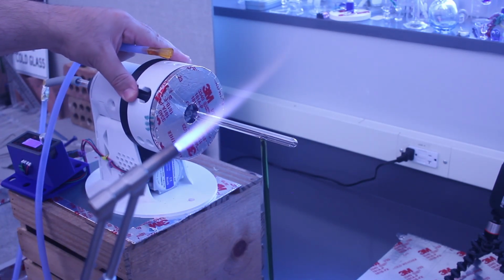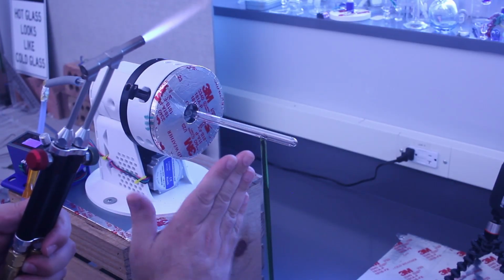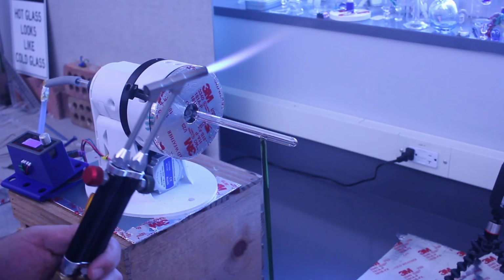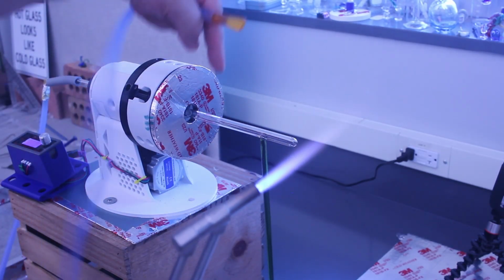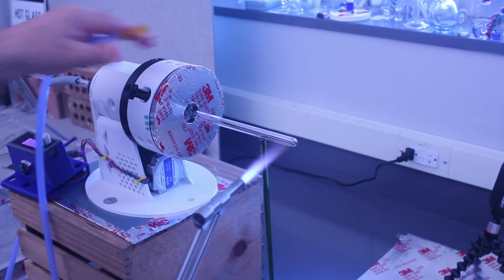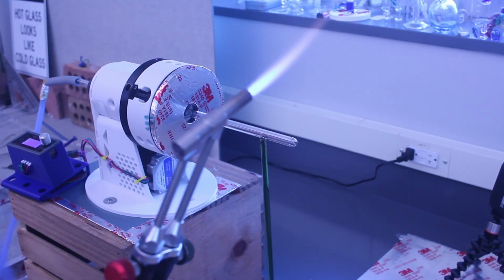And something that usually happens when I do this by hand is the rod tends to end up at an angle that I don't intend. So by having the ability to rotate it 180 degrees where it's effectively pointing straight down, I can warm it up, and then gravity will actually help align it.